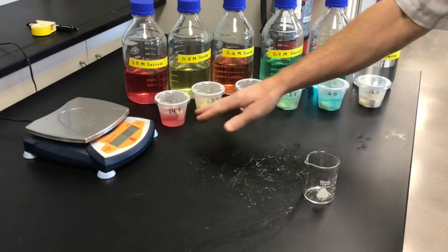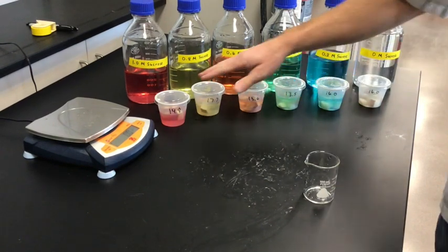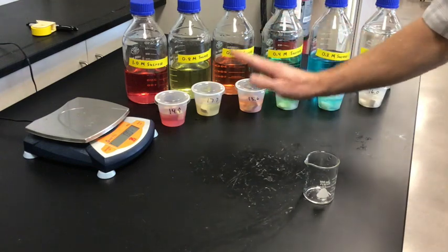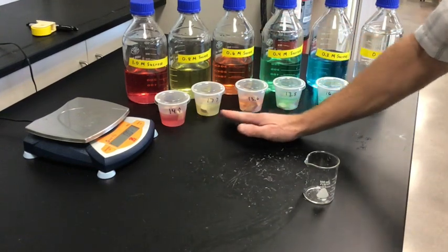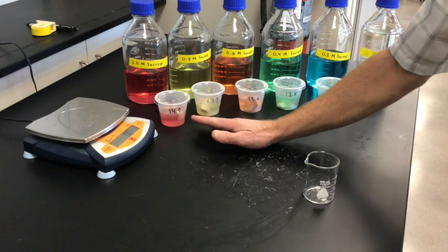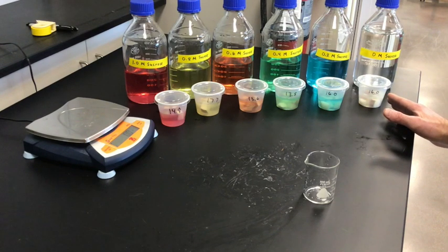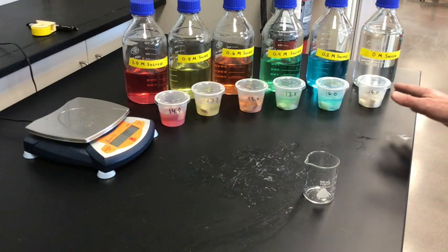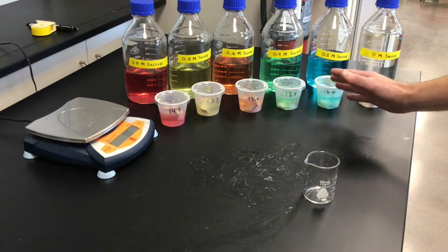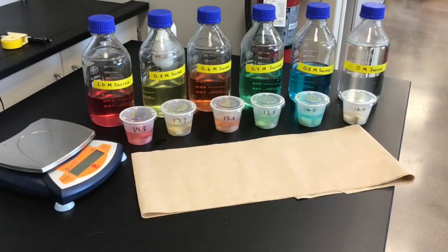I'm going to let these sit overnight — I might put them in the fridge for a couple of days — then remove them from the containers, rinse them well, dry off the potato chunks, and re-weigh them. I'm anticipating that the potato chunks in the very sugary, hypertonic solutions will weigh less, and the ones in hypotonic solutions will weigh more. At some point there'll be a cutoff we can graph to determine where chunks go from losing mass to gaining mass — that would be an isotonic solution.